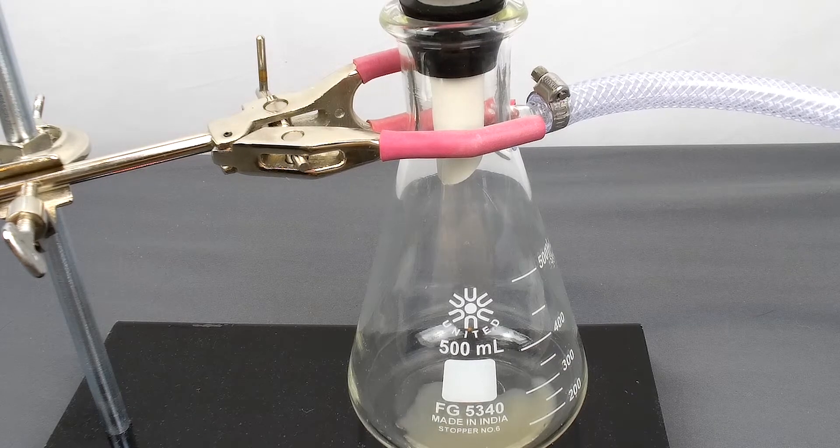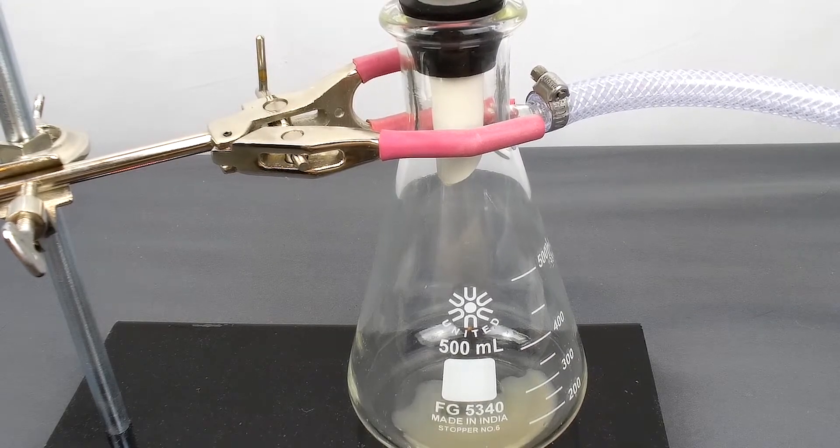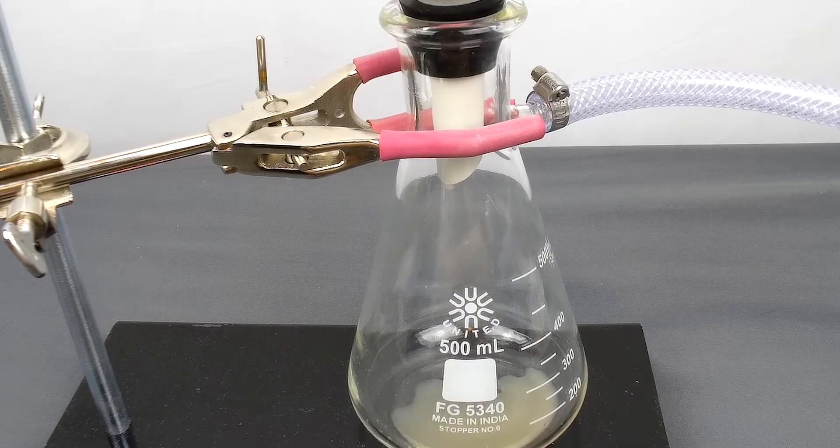So that's just gravity alone, and then when I start pumping the air out, it's not instantaneous, but it is definitely quicker than just letting gravity do the work for you.